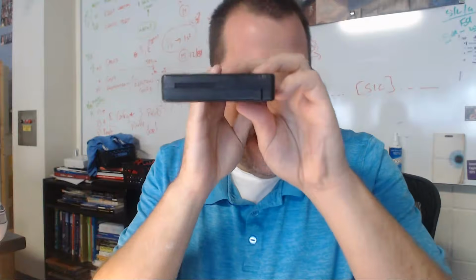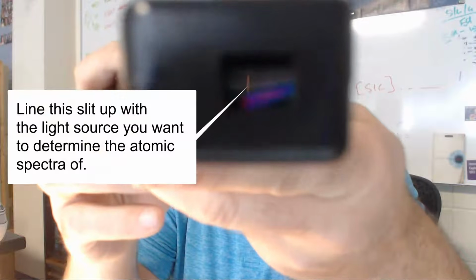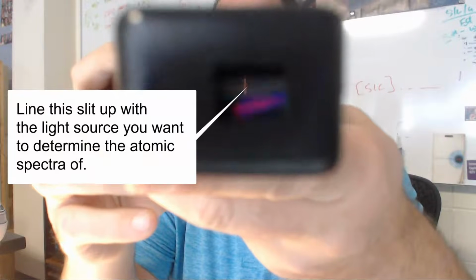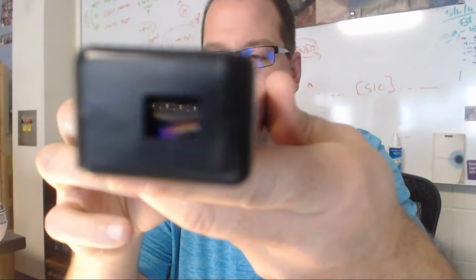So I would look at it like this and see stuff. You would kind of look at it like this, and you can see the slit right through there, and you're going to line that slit up with the light source. And then when you do, you look over here, you see the scale and the numbers that you would get. That is going to show where the spectra of the element is going. So let's take a look at neon.